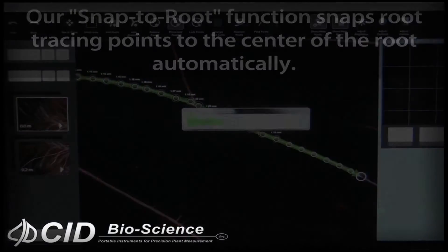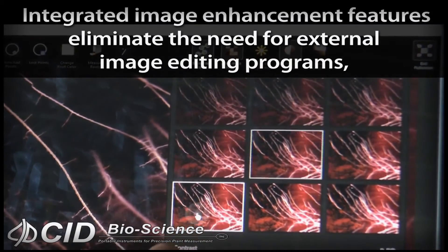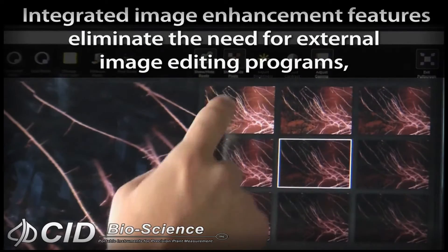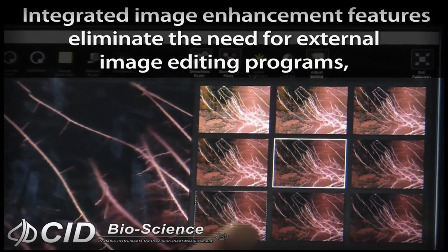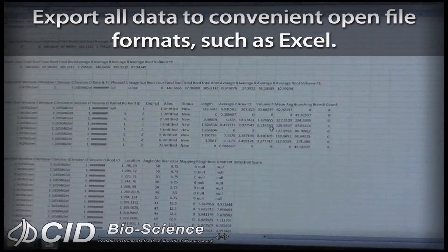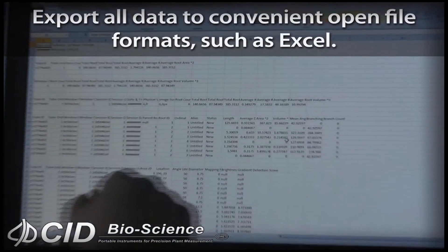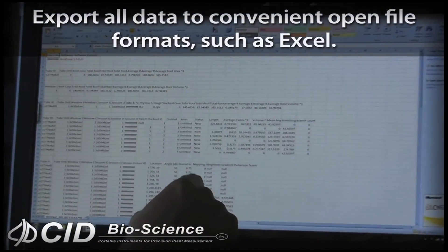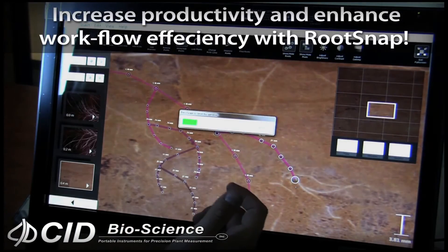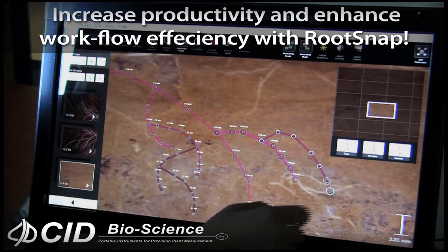Additionally, RootSnap has integrated image enhancement features which enable users to optimize each scanned image for more accurate processing. Store information in common file formats and export data to Excel. Increase productivity and enhance workflow efficiency with RootSnap.